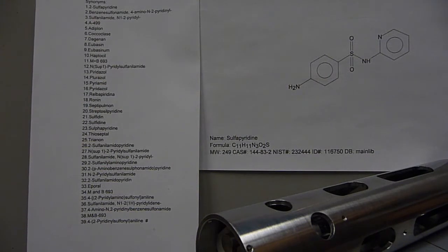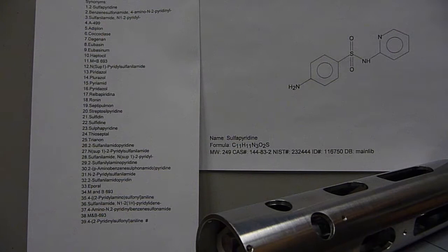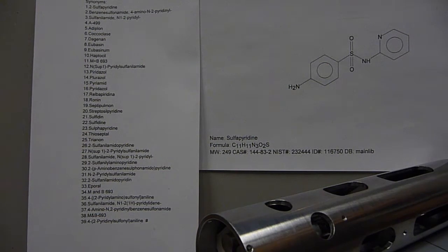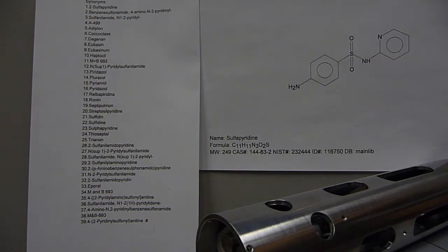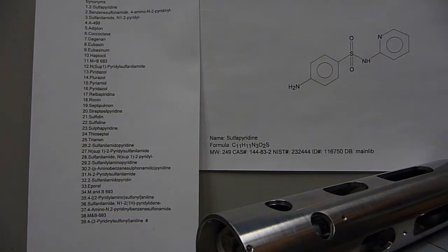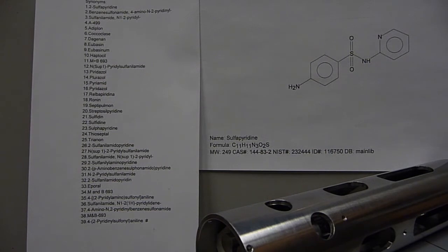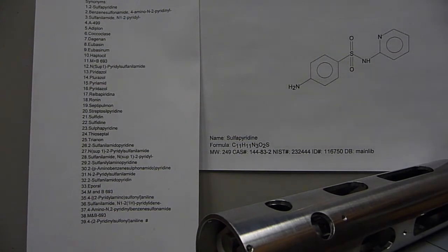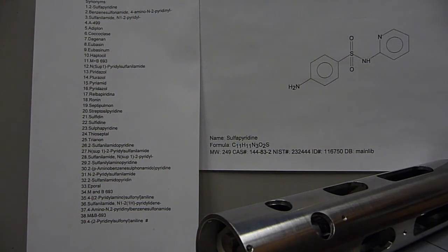This video is intended as a quick overview of three different ionization modes of mass spectroscopy using the same compound, then adding in some additional physical chemistry and MS-MS information, and hopefully gaining an enhanced appreciation of the sulfur dioxide expulsion with rearrangement occurring in several sulfonamides. We'll be concentrating more on the data and less on the data acquisition methodology. References will be at the end of the video.